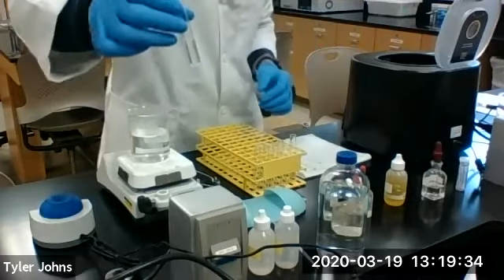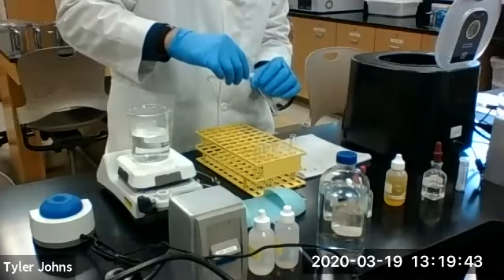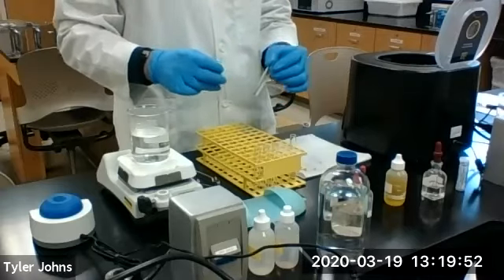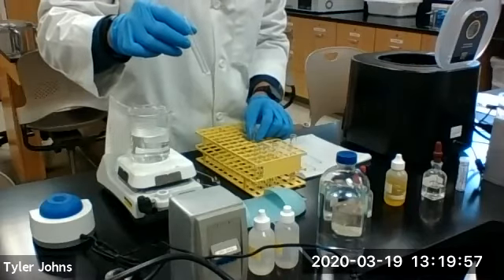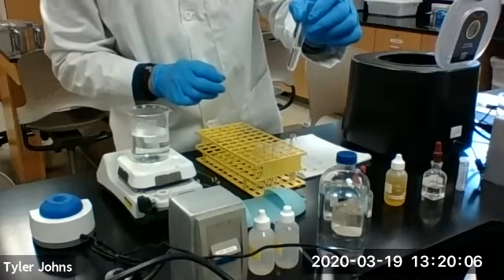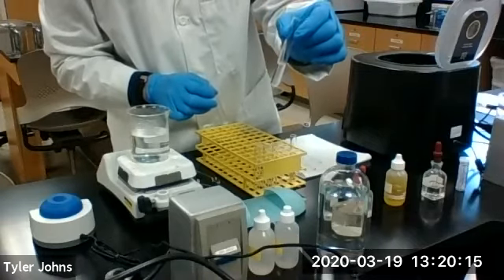Now we're going to decant the solution from this. This would be your S1 solution. We will transfer the S1 solution into another test tube. Now for today, we are only analyzing group 1, or chloride group, ions, so we do not need to save S1. However, if this solution had other additional ions from groups 2 through 4, we would need to save this for further analysis. For today, we're going to discard it.